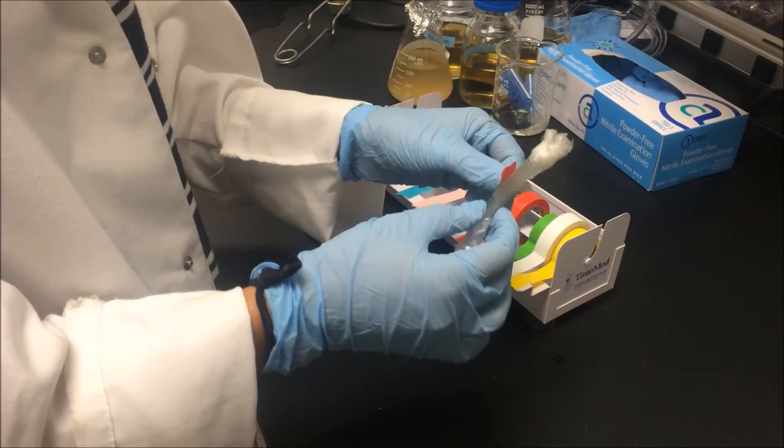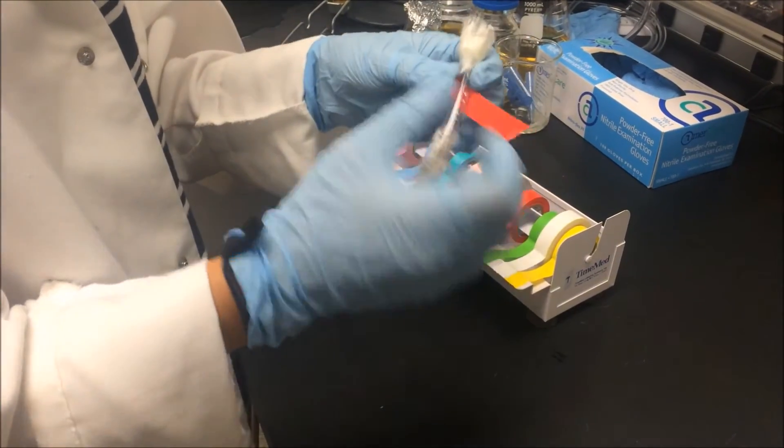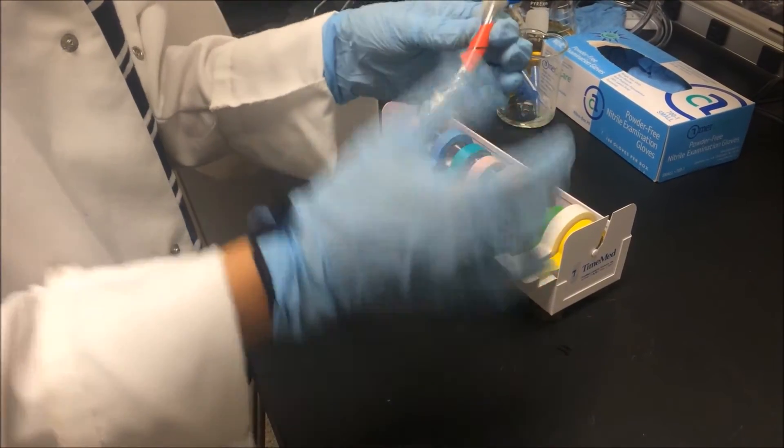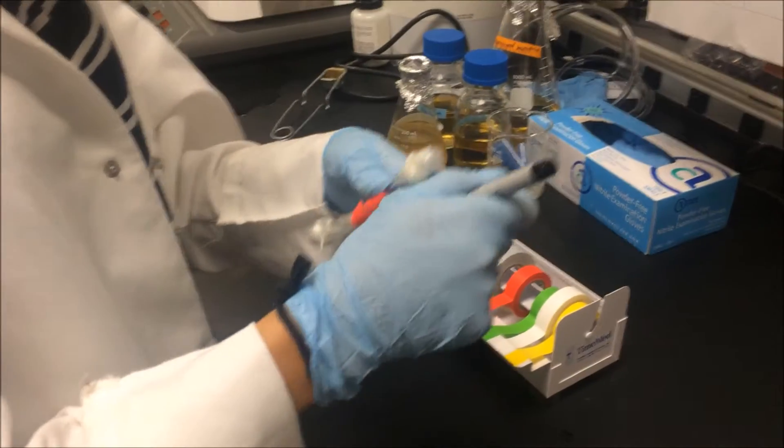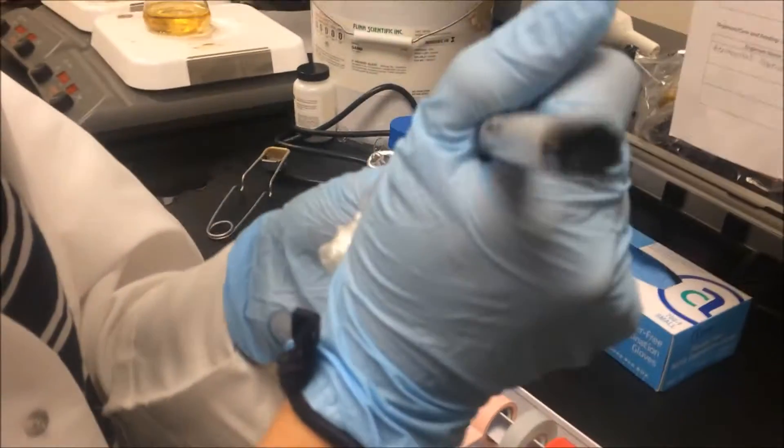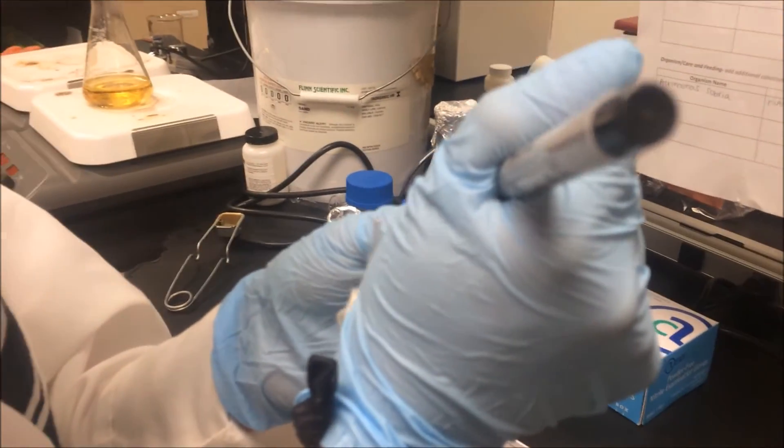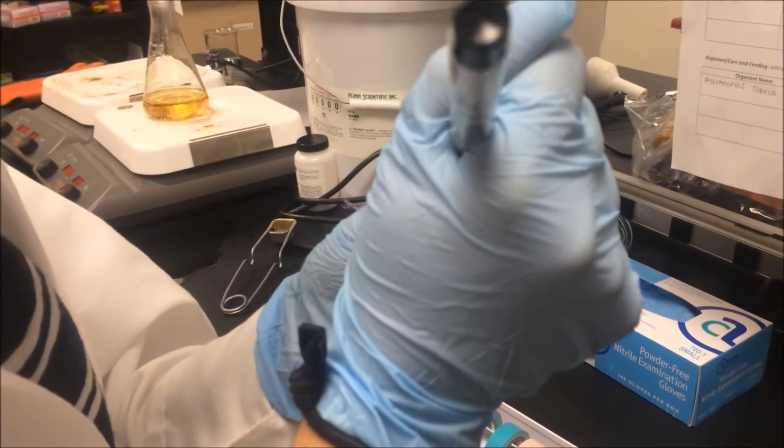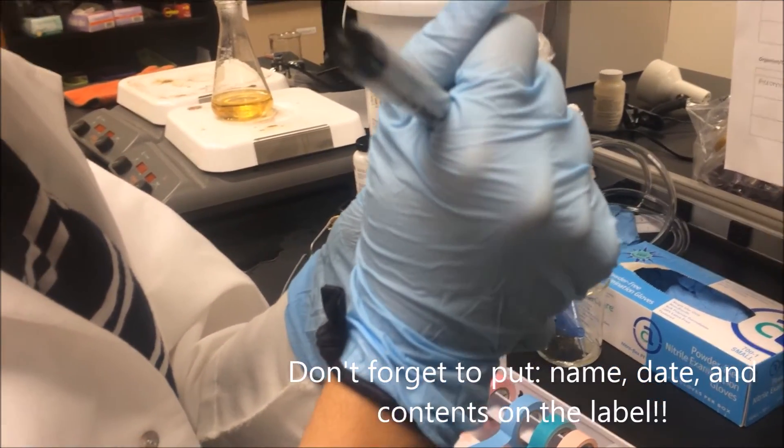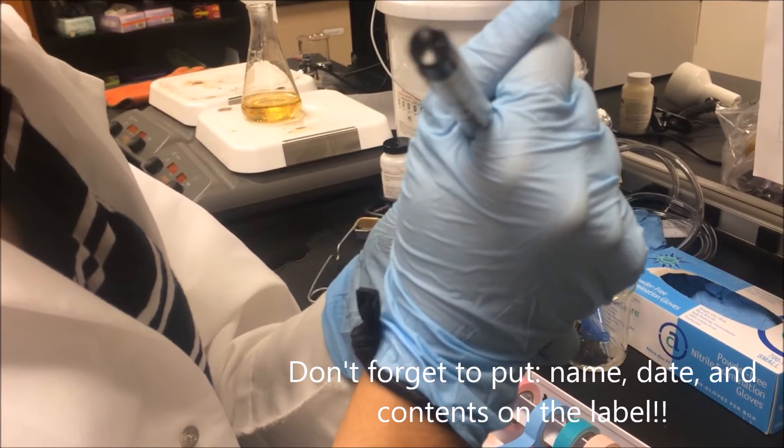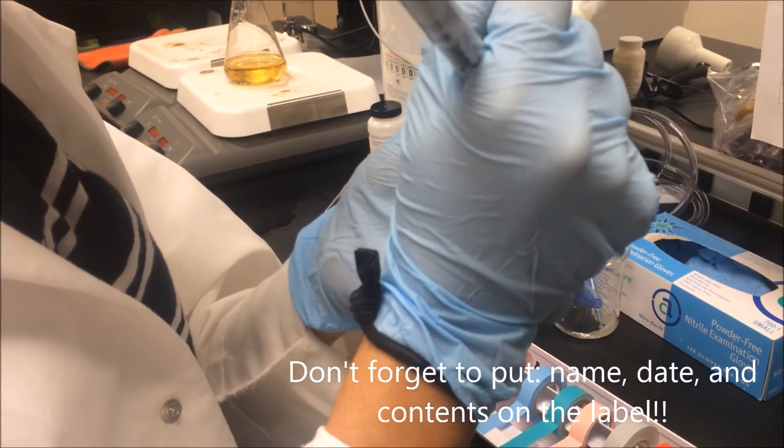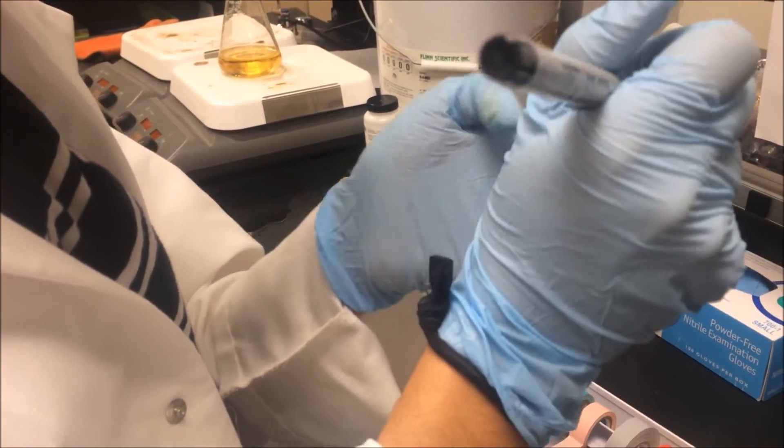Tear label. Label. Don't forget to put the date.